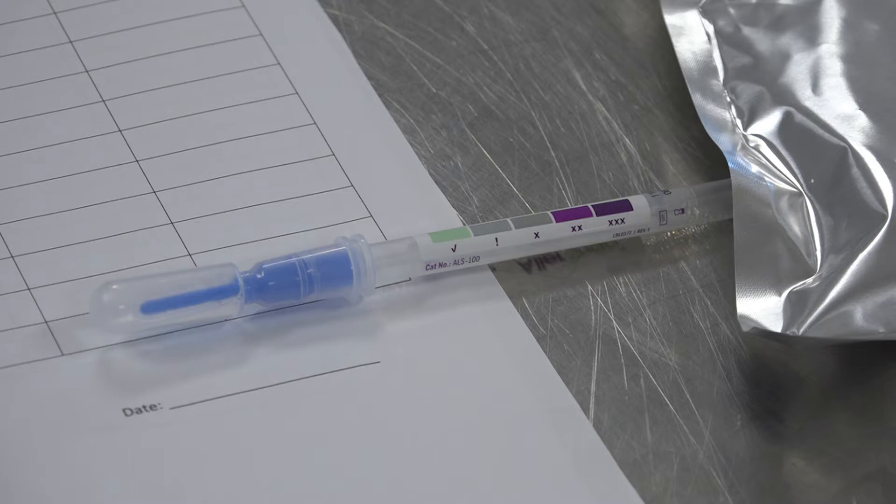This test should be completed after cleaning. Results are based on the color of the liquid in the tube. Green means clean and purple means protein is present.